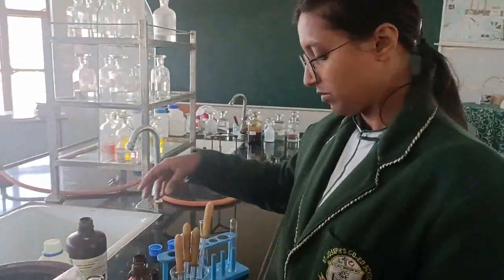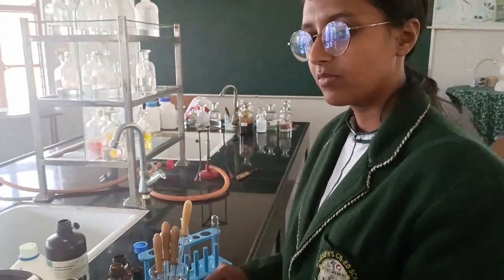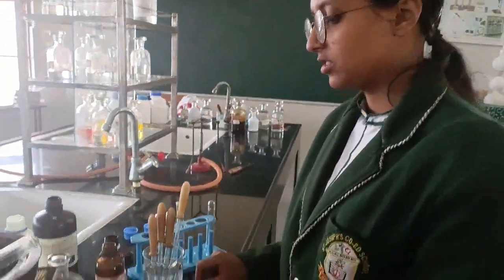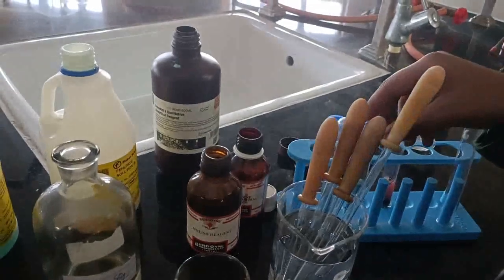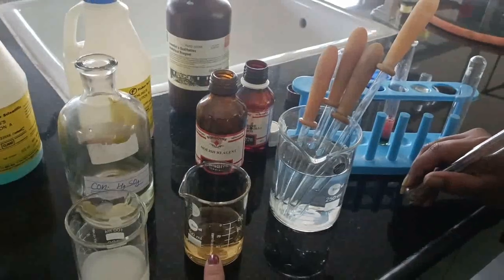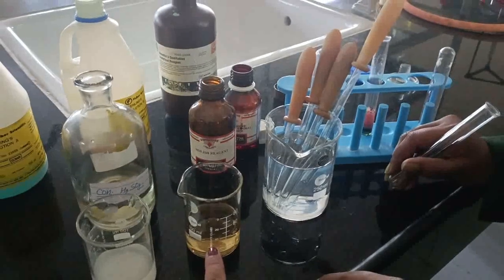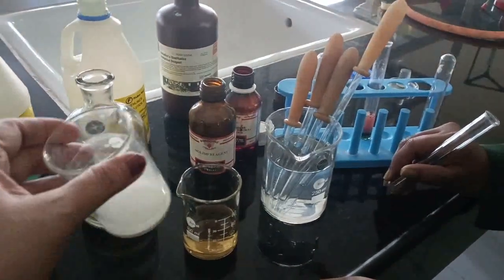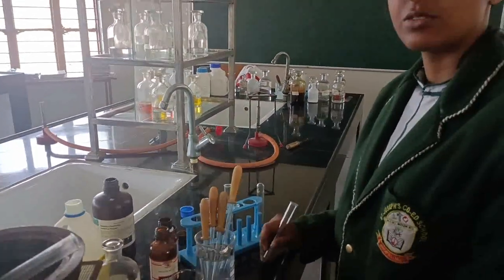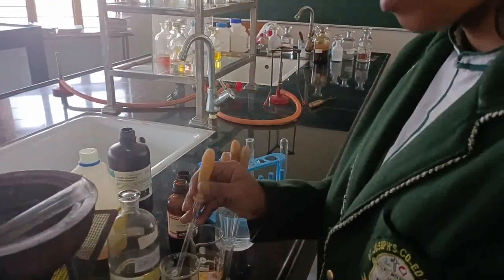These were the three main tests which we have done for carbohydrate. So we are sure that the given sample is carbohydrate, but one more test we have, which is for starch. Here we are keeping two solutions. One is glucose solution. We have dissolved glucose powder in water, and with this you have done the three tests. But the glucose solution will not give you the test of starch. If somebody gives you starch, then one more test is there for testing carbohydrate, that is the iodine test. So take the sample from the second beaker, around 1 ml.